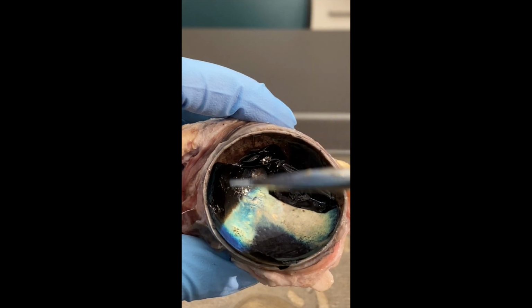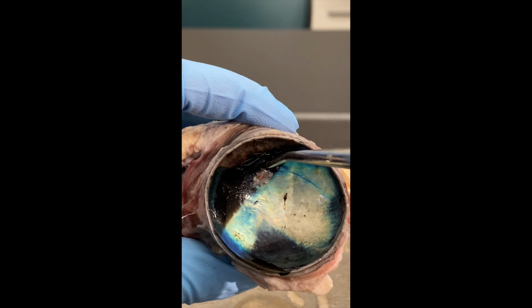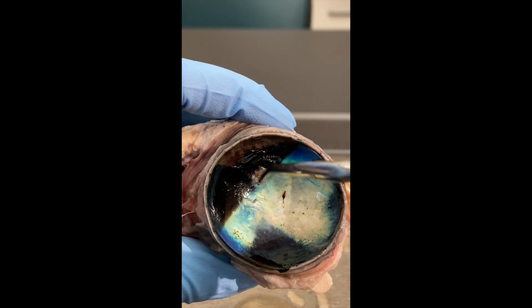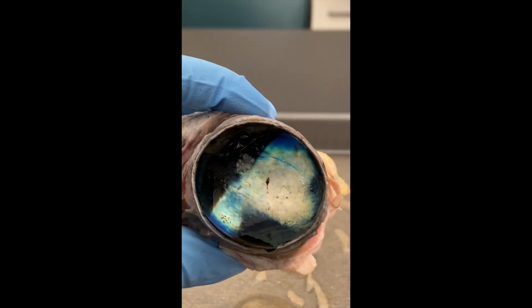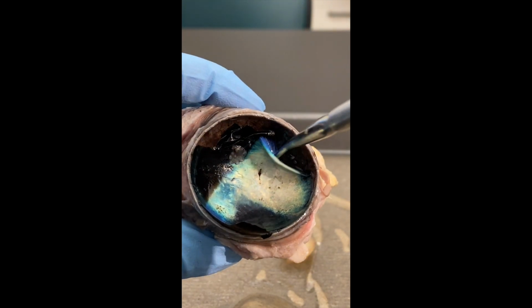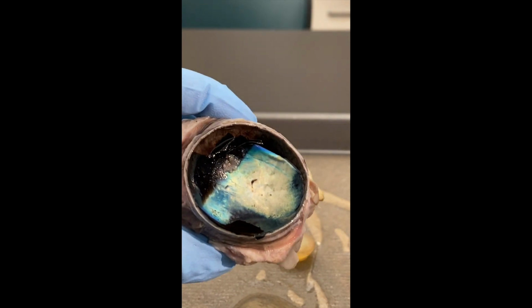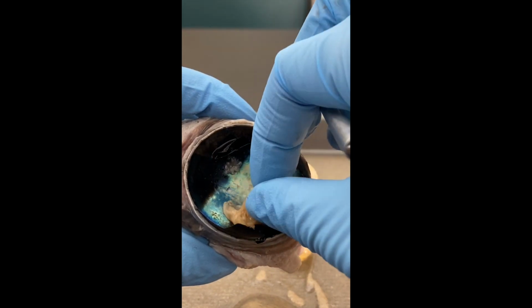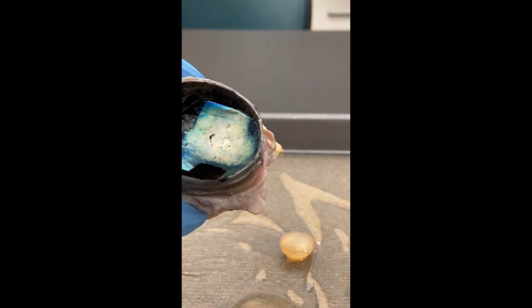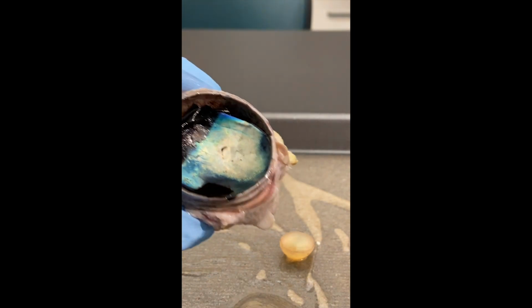So this whole hollowed out area again, that's the posterior cavity, not to be confused with the chamber. The sclera is the outermost, then you would hit the choroid, tapetum lucidum, and then you'd have the retina inside of that, and then you'd have the vitreous humor on top of it. Those are the different layers.